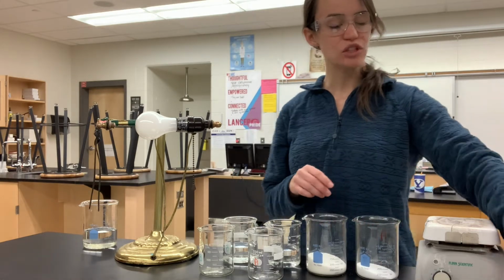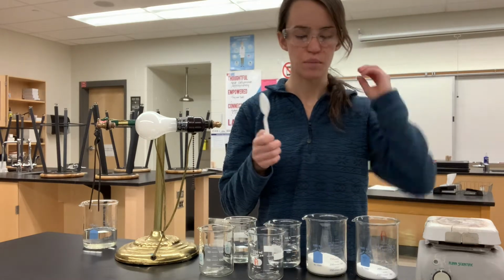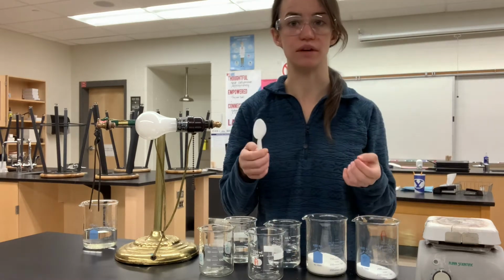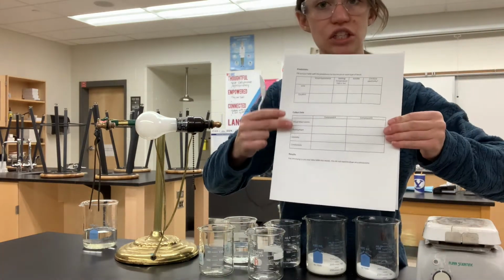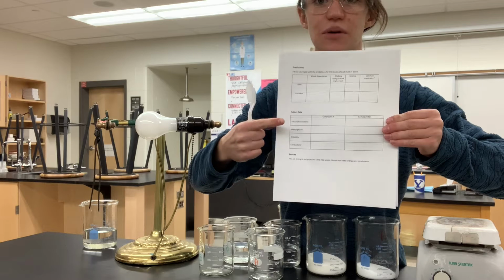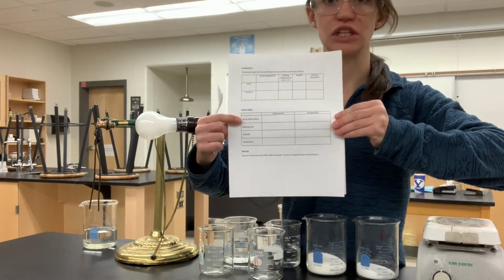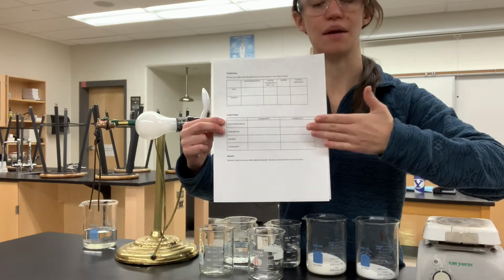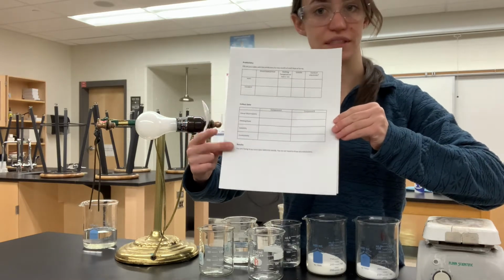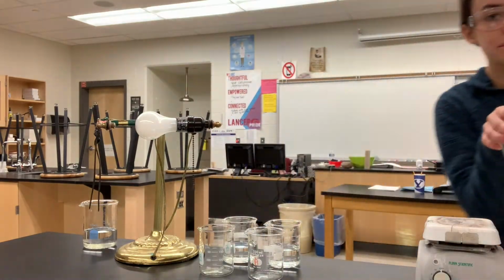So for the visual test, I'm gonna try to show you on the camera. It might not come out very clear, but just try your best to write down your observations as we go. You're gonna do this all in the data collection section of your lab sheet. Up here it says visual observations. As I show you, write down some visual things that you notice about A and about B. Continue to fill this out as we go through. So let me bring these closer to the camera so you can see.